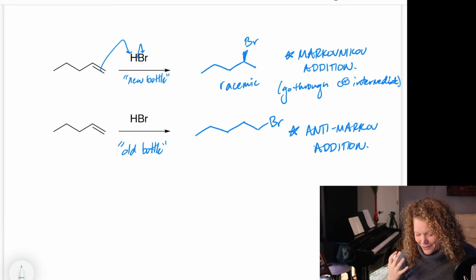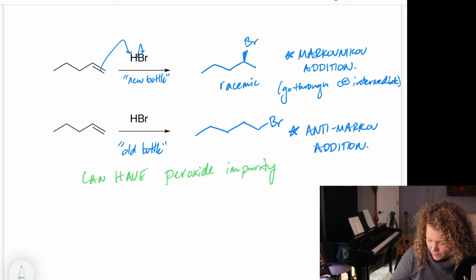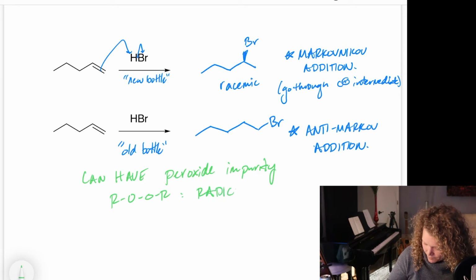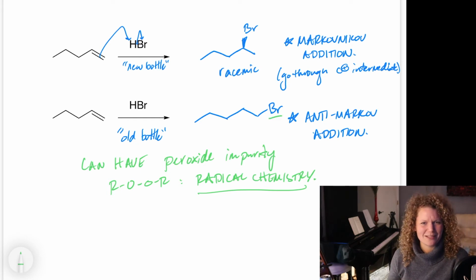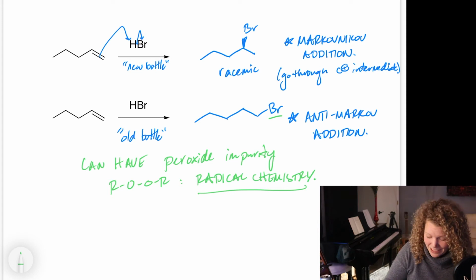Okay, so actually, a really old bottle of HBr will end up having some peroxides in it. And this is what's actually pushing the reaction through a different mechanism. It can have a peroxide impurity. And so it's this like ROOR. And this thing likes to do radical chemistry. And so you end up not getting the product that you wanted. You end up getting anti-Markovnikov addition, the bromine added on the least substituted side, okay? Your proton should have been going on the side that already had the most protons, and it didn't. So this makes you quite unhappy.